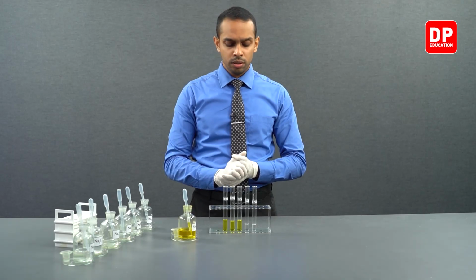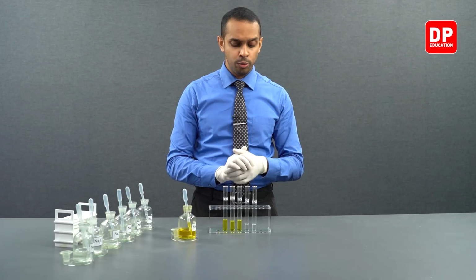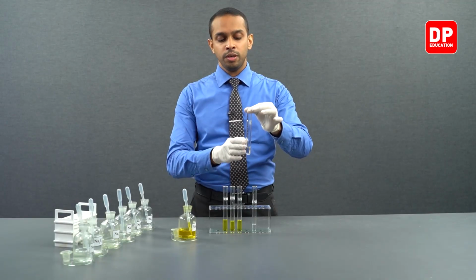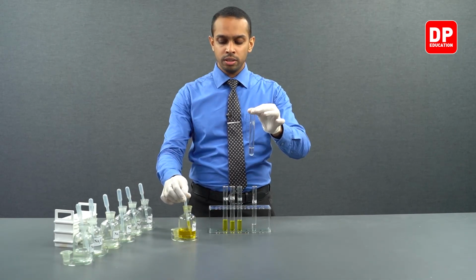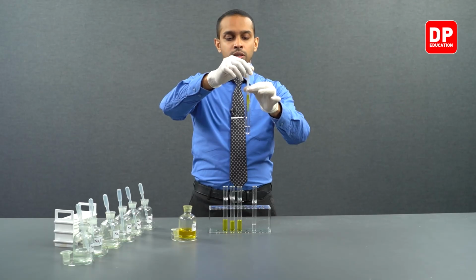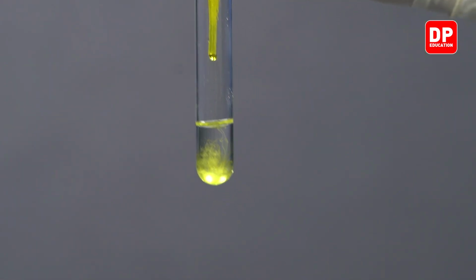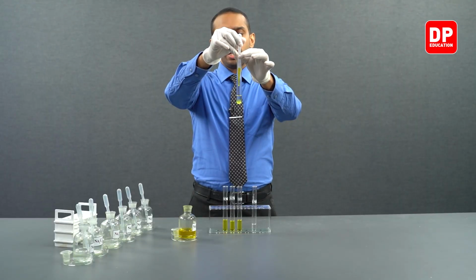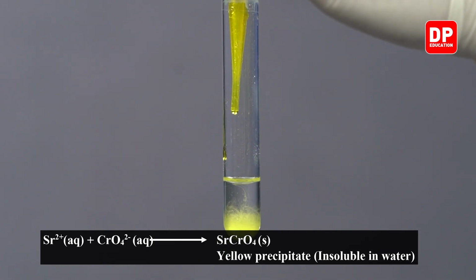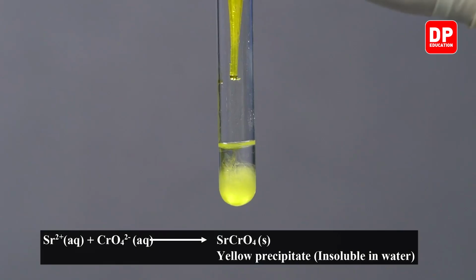Now we have our strontium 2 plus aqueous ion solution. Let's take a small amount of strontium 2 plus aqueous ion solution, and to that we will be adding sodium chromate. You can see as soon as we added just one drop of sodium chromate, it formed a yellow color precipitate.